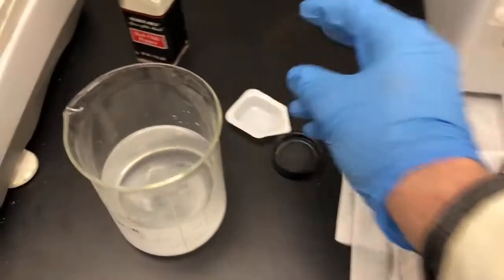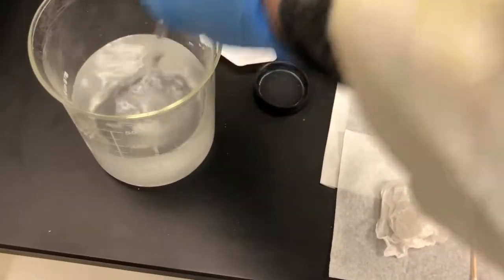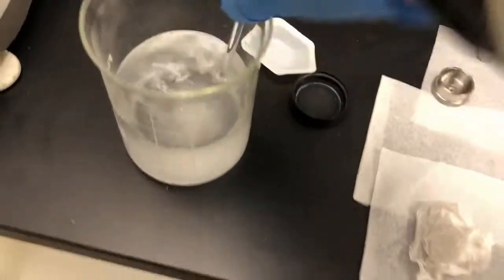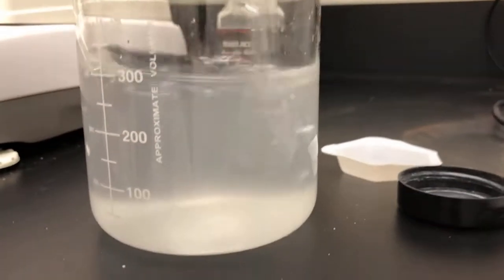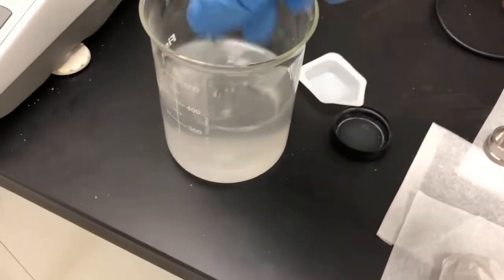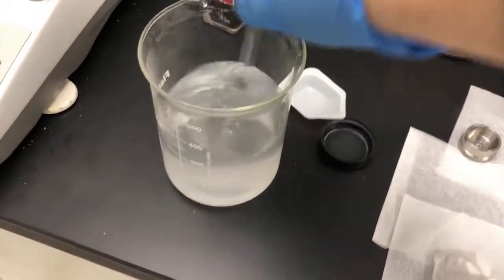I'm stirring this with my handy stir rod which I've already cleaned, believe me. What's the solubility? Are we soluble for salt and water? At least at this concentration, we are.